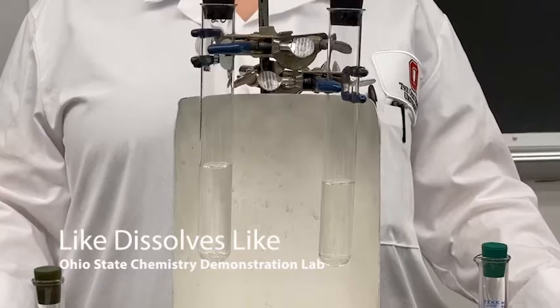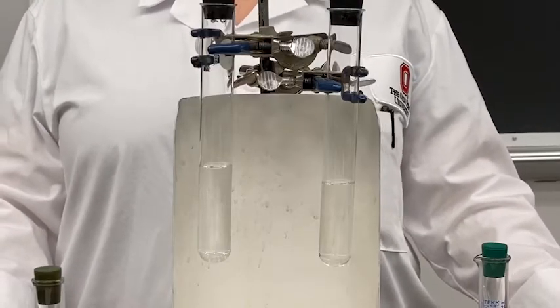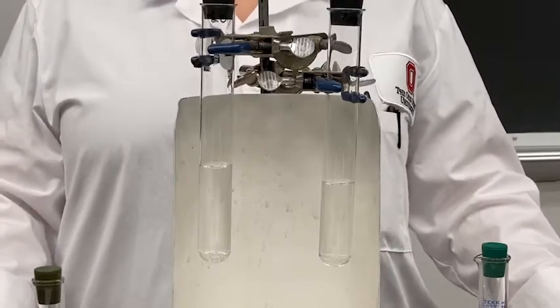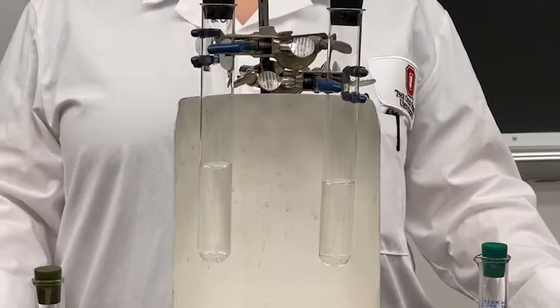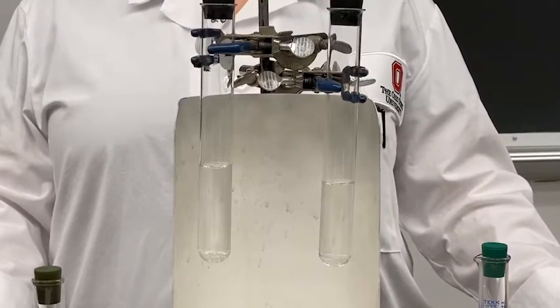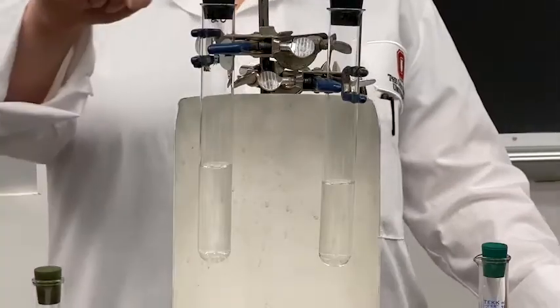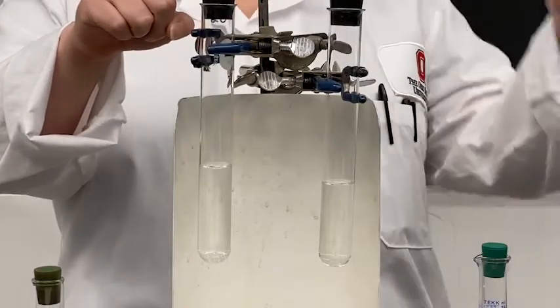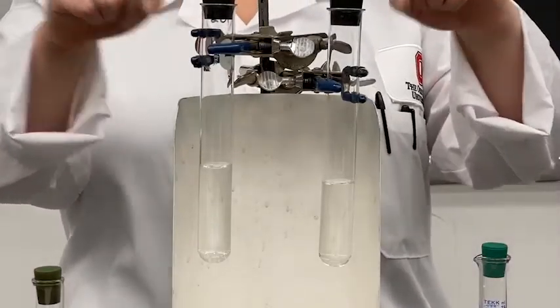An important concept in general chemistry is the principle of like dissolves like. This means that nonpolar solutes dissolve in nonpolar solvents, while ionic and polar solutes dissolve in polar solvents. Here I have water, which is polar, and here I have hexane, which is nonpolar.